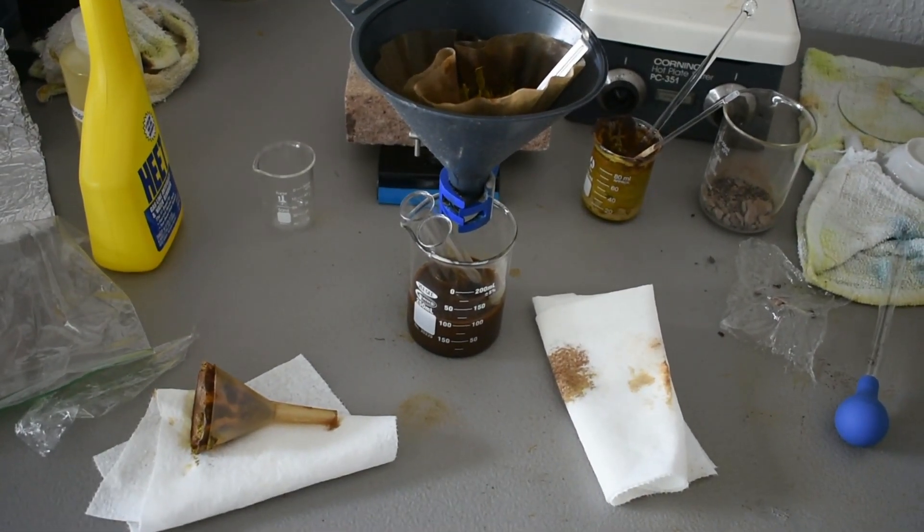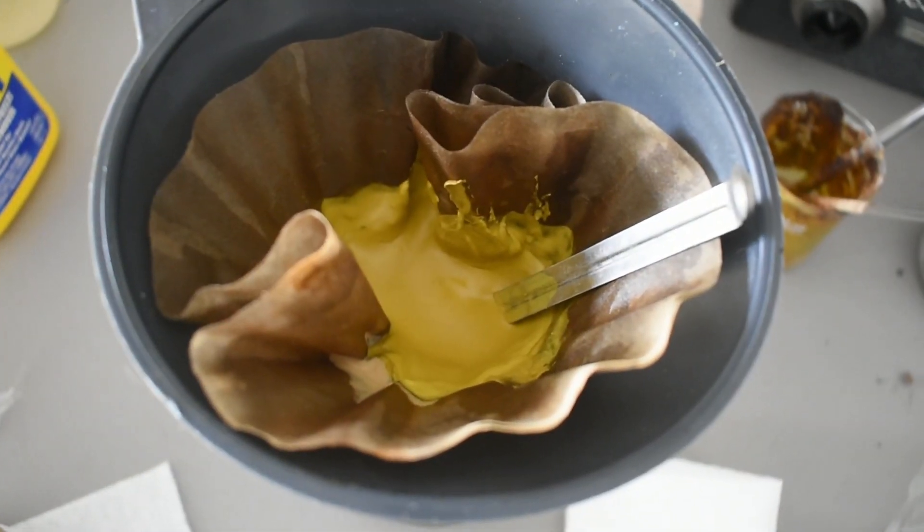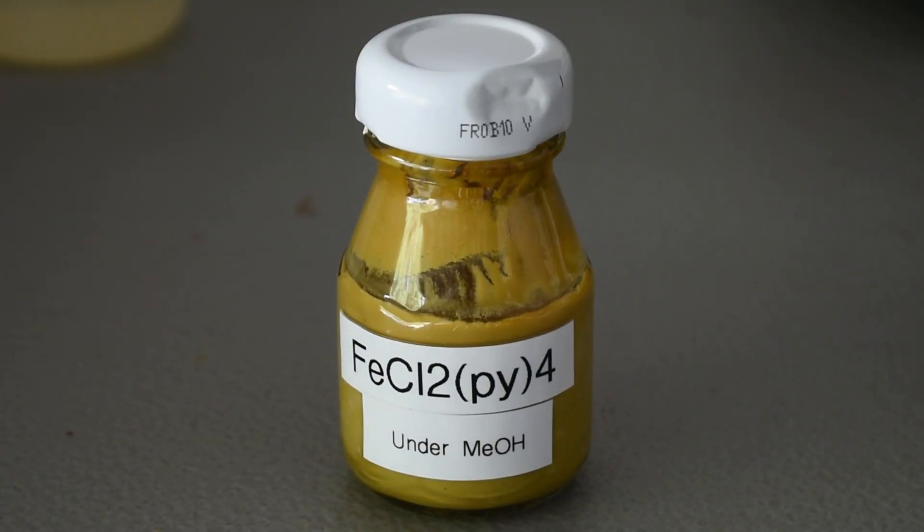As you can see, I've made quite a mess. But we do have our product. Here's our final product in the bottle.